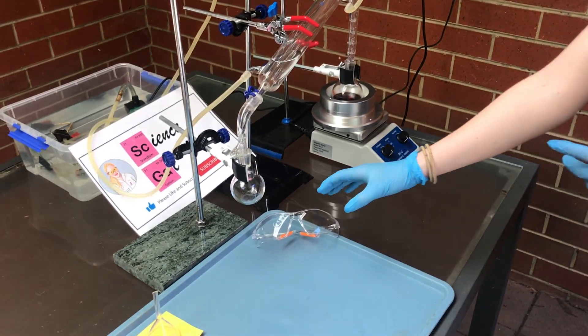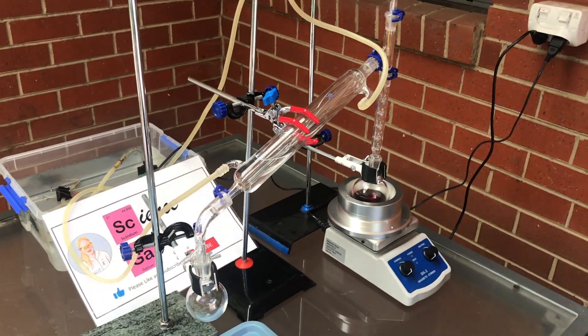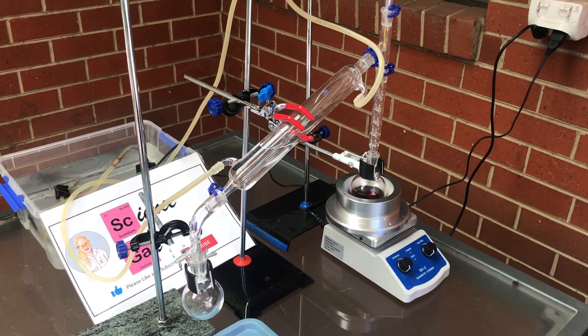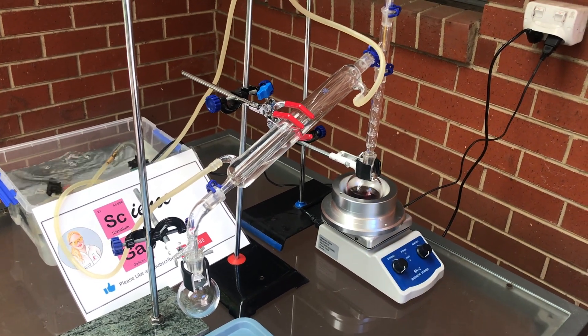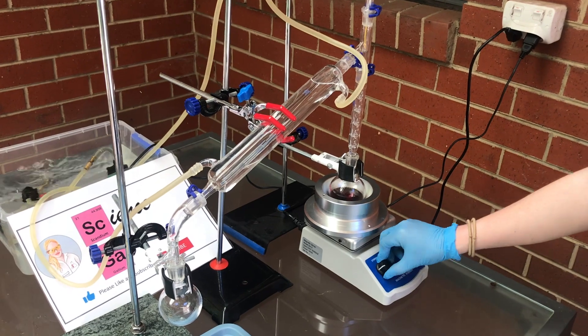Once everything was set up I put on my protective eyewear, gloves and turn on the power to start the distillation. Once the water has filled the condenser I then turn up the stirring and heating.